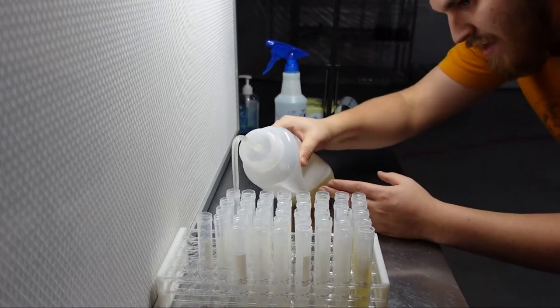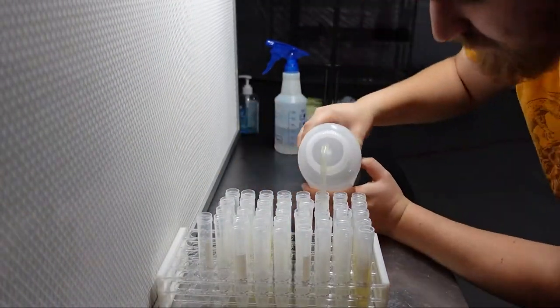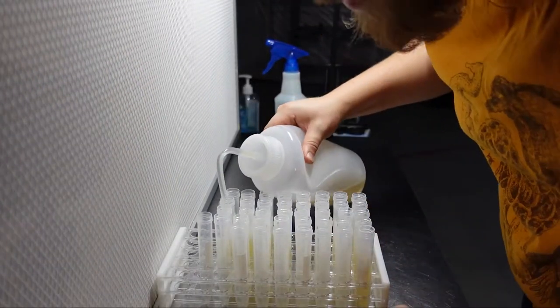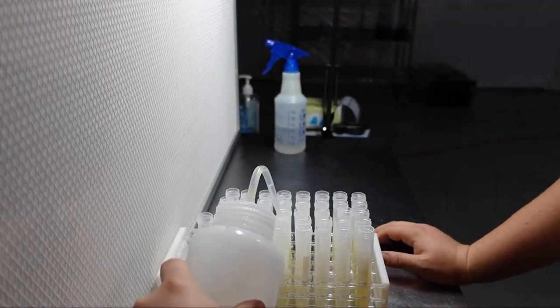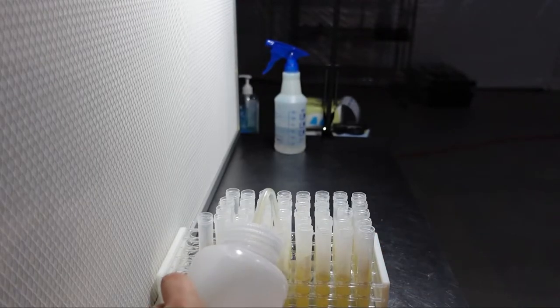Fill each tube about halfway with the media. I'm using 15ml tubes here and filling them with about 7 or 8ml of media.